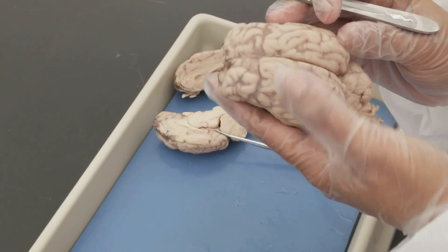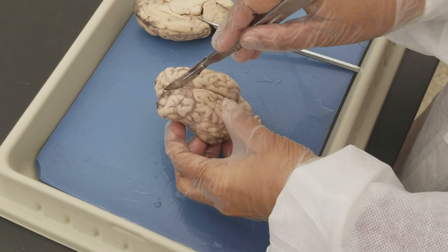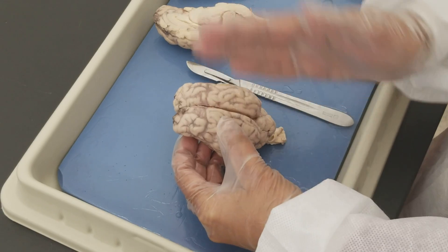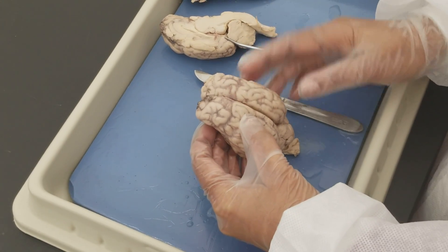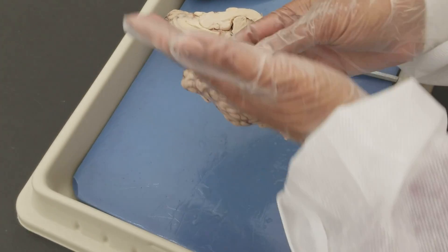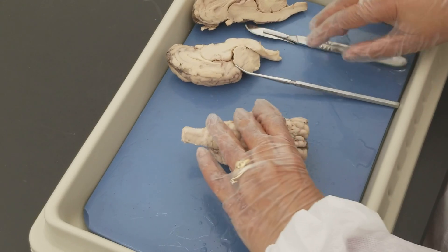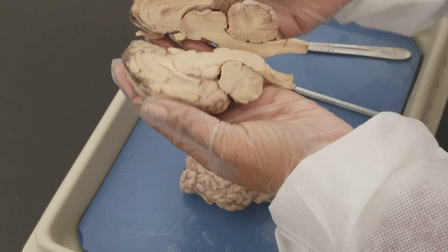Now for the dissection, you perform a mid-sagittal section. Place the brain specimen down on the tray, then with a scalpel slowly cut — you cut and you tease. As you tease, you'll see there's no real physical connection between the two cerebral hemispheres, but at a certain point on the floor you'll see a carpet of white fibers. That's the corpus callosum, the biggest white matter bundle in the brain. You cut from both sides following the natural midline, and once you have two halves, left and right, it looks like this.